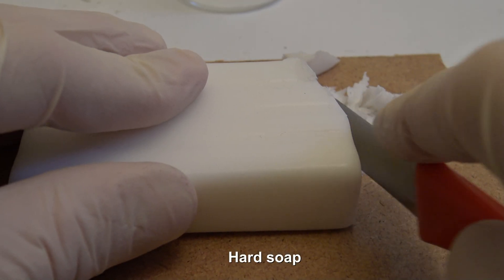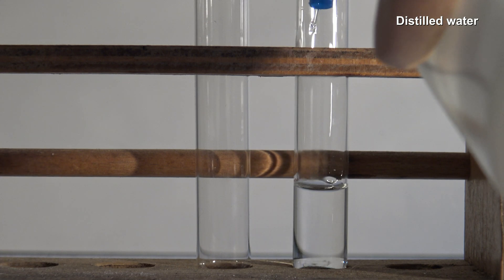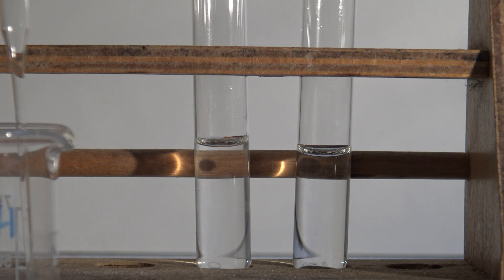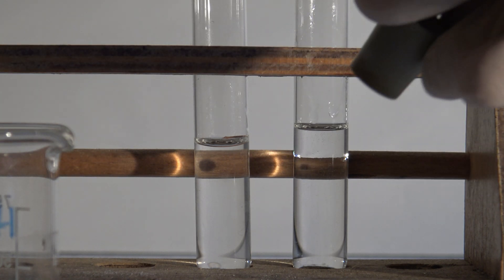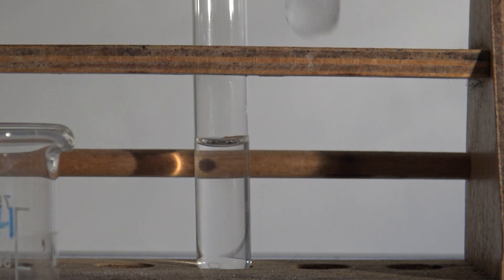But this is not the only influence on our everyday life. When washing clothes or cleaning dishes, water hardness has an important role. To show this, a saturated solution of hard soap and ethanol is prepared. Next, two test tubes are prepared: to the first one distilled water is added, and to the second one a 1% calcium chloride solution is added — this represents hard water. To the distilled water about 1 ml of the saturated soap solution is added, the test tube is closed with a stopper and shaken.